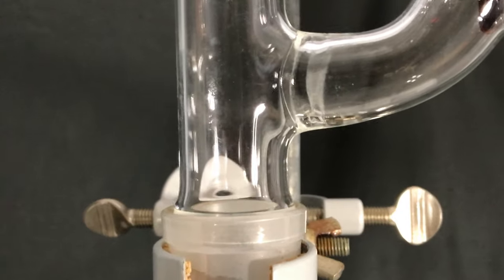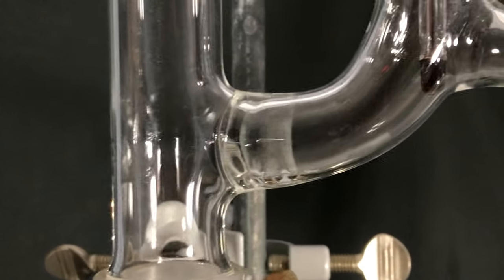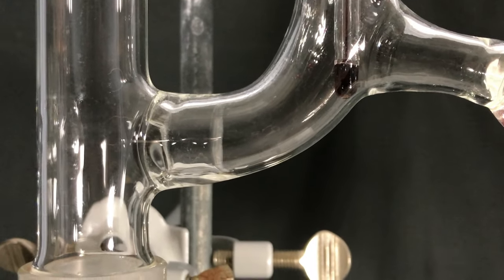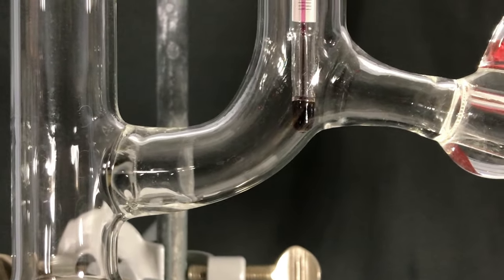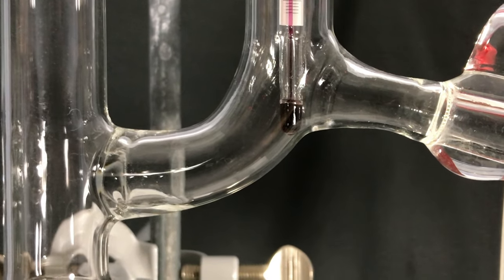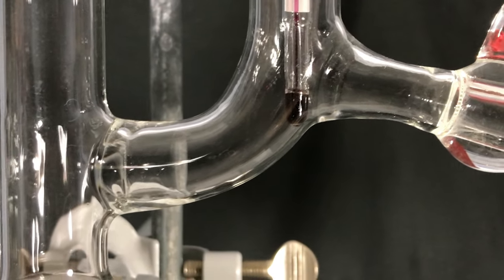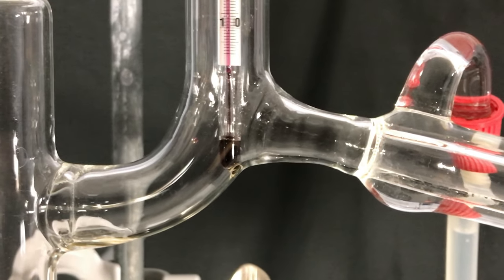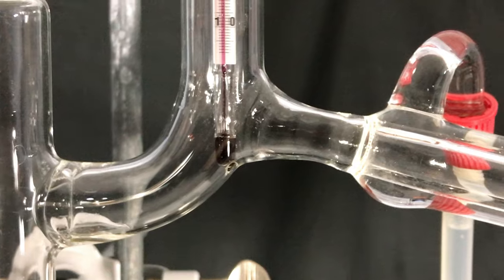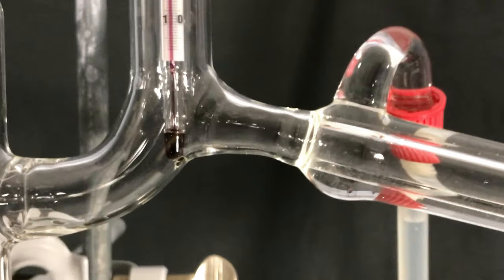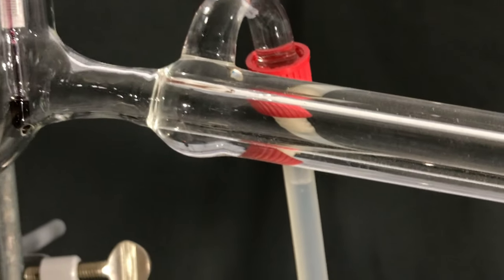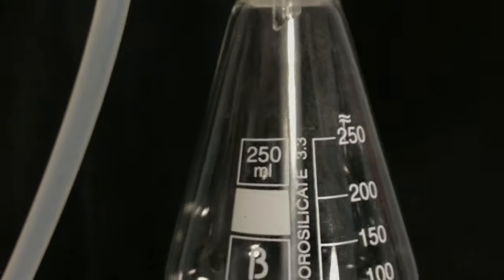This is what the vapor front looked like when it started climbing up. I always find that part highly interesting because it just looks mesmerizing when you look at it in real life. First drops of our product were collected.